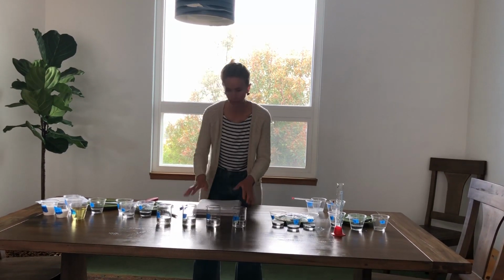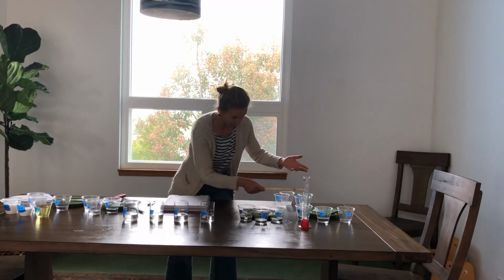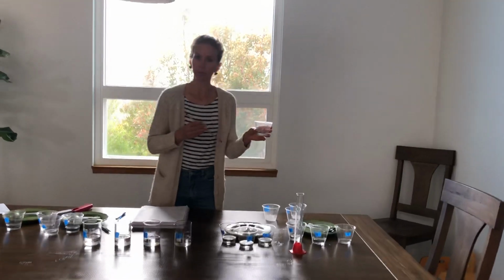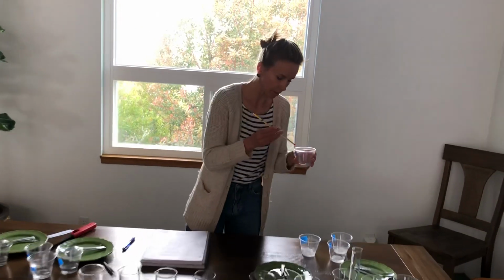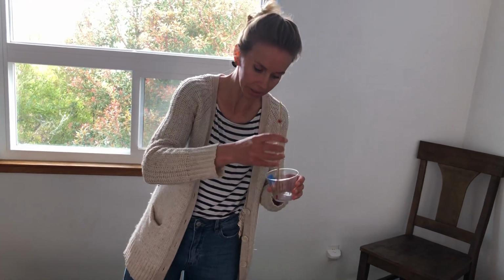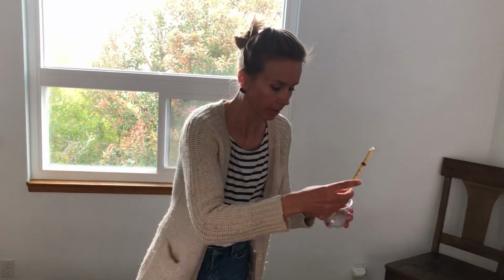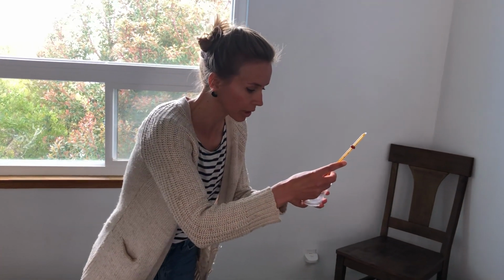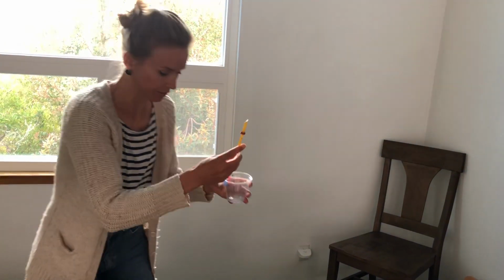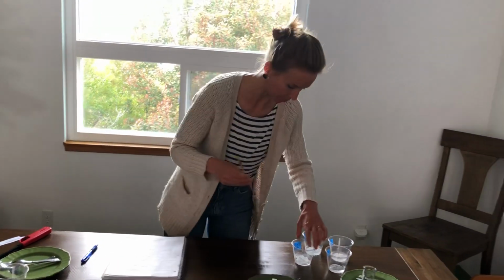So I've had our 4 liquids in my freezer overnight. These are the same 4 liquids, and I took them out of the freezer a few minutes ago. So number 1 has just started melting. So I'm going to take its melting point. So I made a point to set these up just before I started filming. Okay, so I'm taking the temperature, and the melting point of number 1 is 0 degrees Celsius. So write that in, and melting point for number 1.